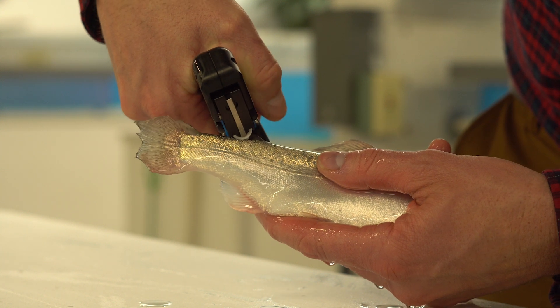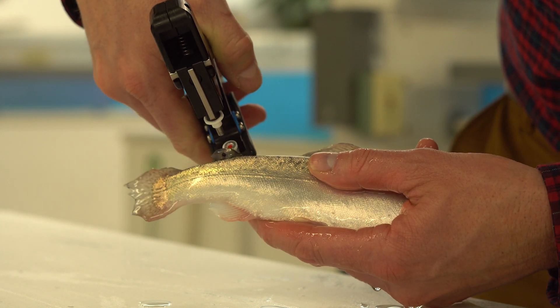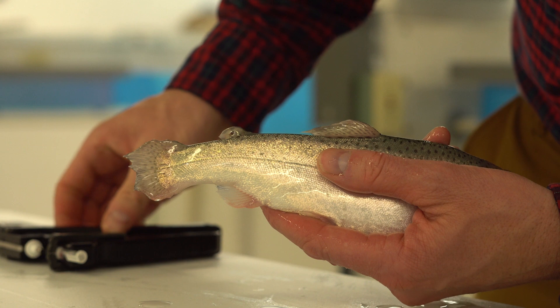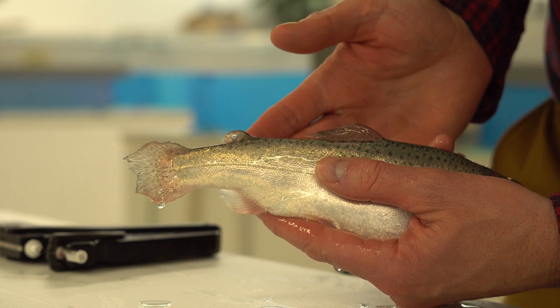Here's an example of an adipose clip being taken. Make sure the applicator trigger is depressed smoothly and fully to ensure the push rod inserts the sample into the vial.